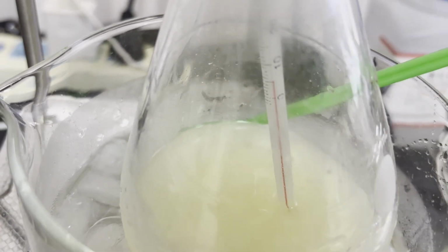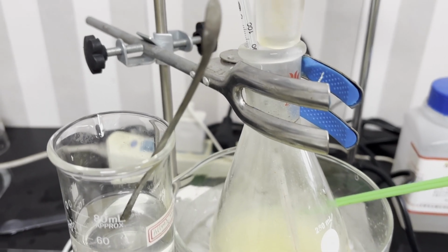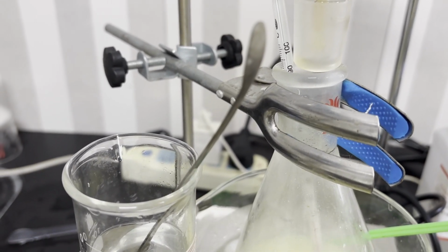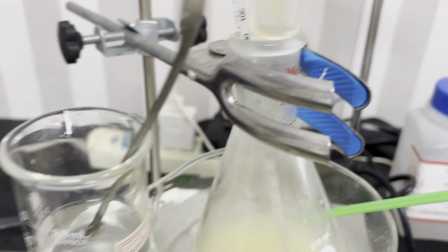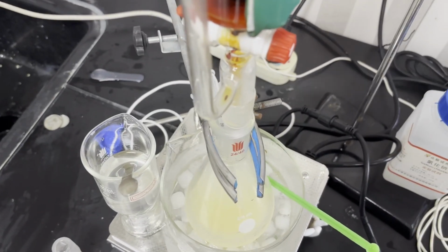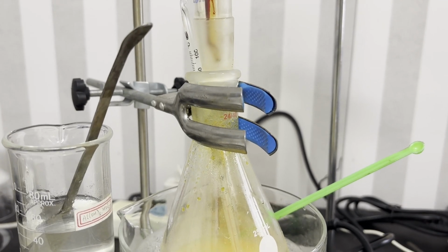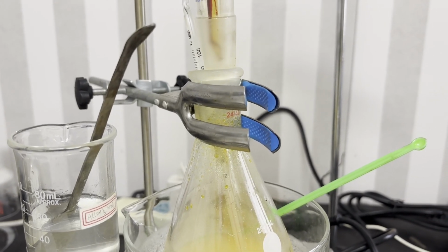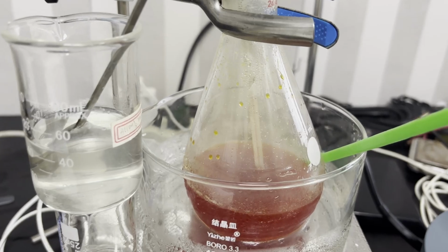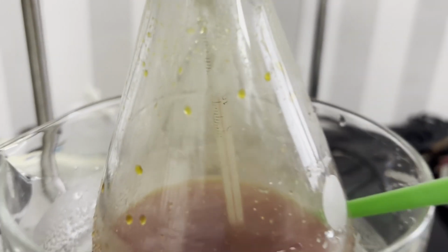As more bromine is added, the mixture turns slightly yellow and the orange bromine color stays for longer. Hydrogen bromide fumes also start forming, and I place a beaker with ammonia solution to neutralize it. For larger quantities, it is necessary to install a gas absorption system. With a fan blowing beside the flask, you can clearly see the ammonium bromide fumes. 40 minutes into the bromination, the color of the mixture is persistently yellow, and after around 15 minutes more, it turned red.